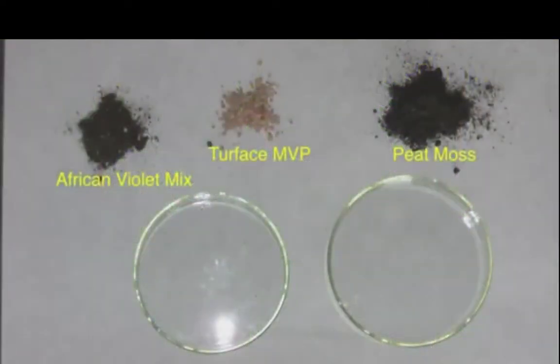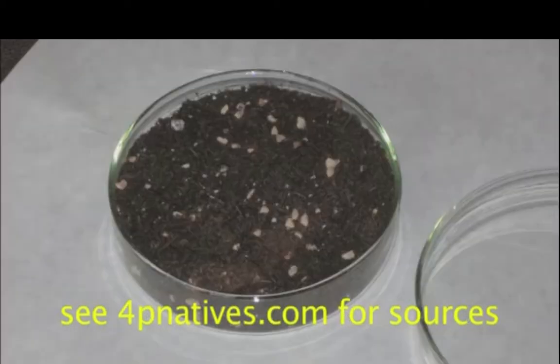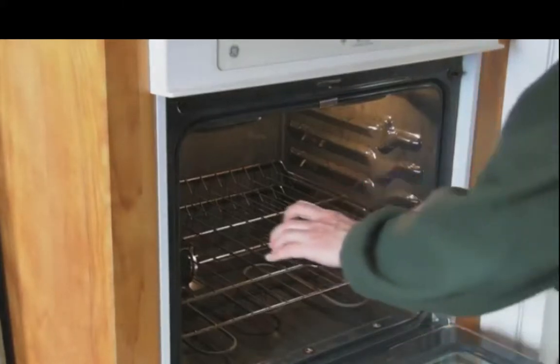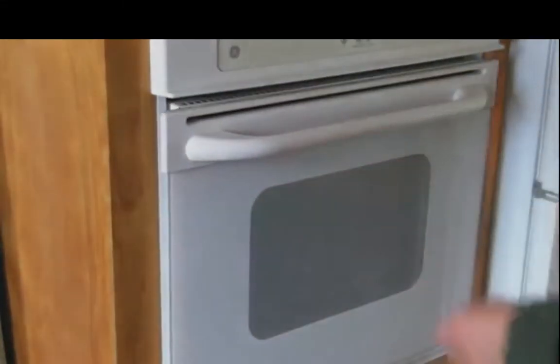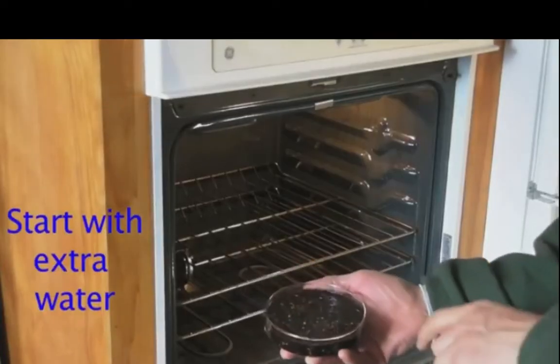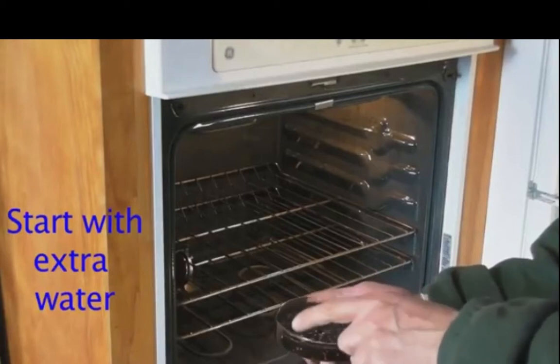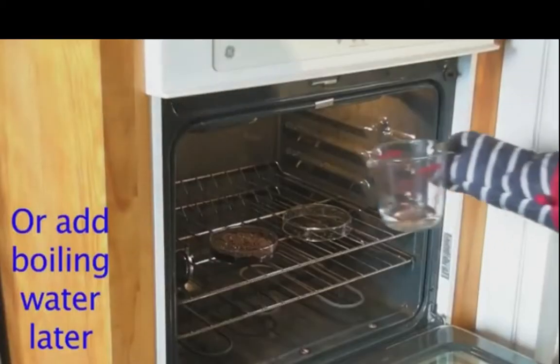Media. I use a mix of 1/2 African violet soil, 1/3 peat moss, and 1/6 Turface MVP. I mix these with distilled water and put them into a 6-inch Petri dish, which will be baked at 200 degrees Fahrenheit for at least 40 minutes. The end result will be a covered Petri dish containing a damp but not flooded, sterile growing medium. Since water evaporates during baking, you need to add extra water to the Petri dish before you put it in the oven. Then bake it until the right amount of moisture is present.